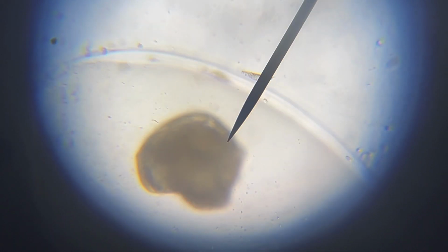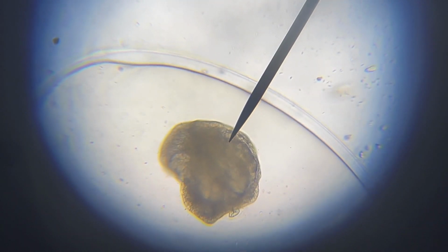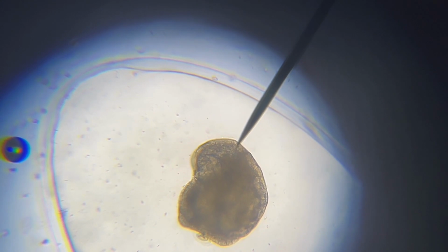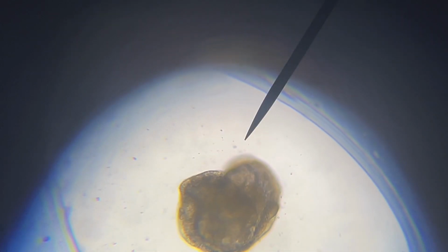Anyway, let's look at the snail egg a bit closer. Did you notice that tiny dark round thing floating inside the egg? That is a baby snail. It has not fully taken the shape of the snail because it is still growing. When it is fully grown, the egg will hatch and the newly born snail will start swimming in the aquarium just like its parents. How cool is that?